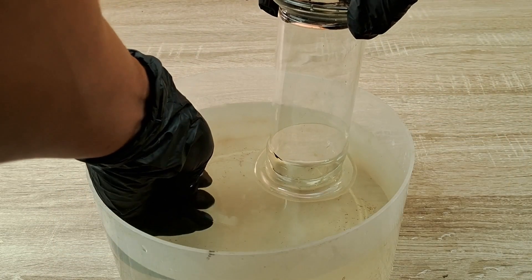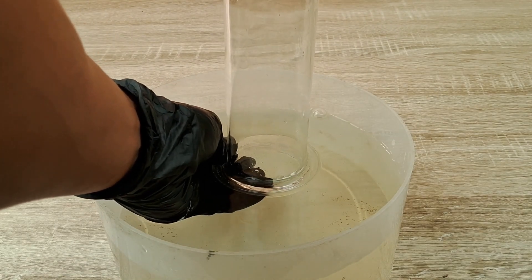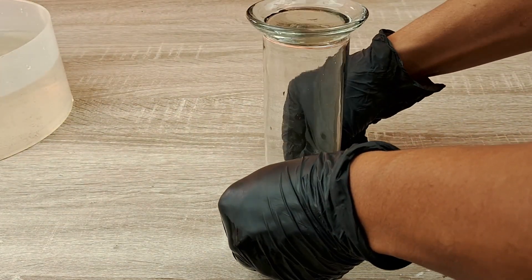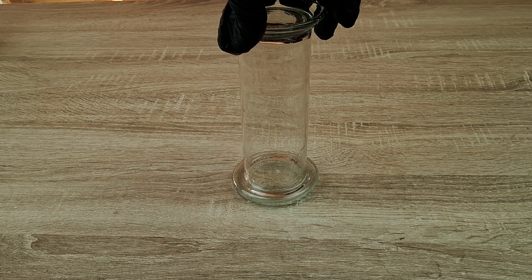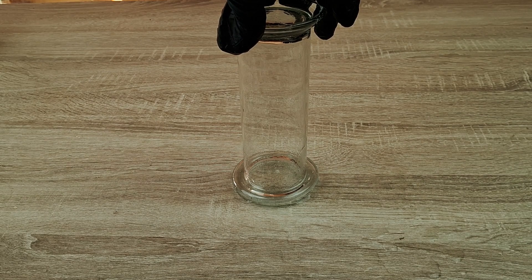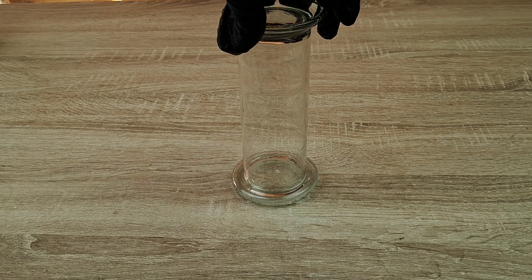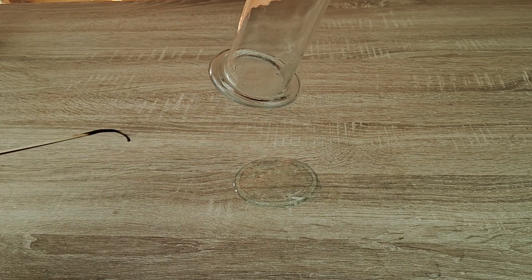Once the jar is completely filled, cover the mouth of the jar with a glass plate or a watch glass and remove the jar from the water. Remove the lid from the jar while still holding the jar upside down, and bring a burning splint, candle, or lighted matchstick close to the mouth of the jar. You will observe that the gas in the jar violently ignites with a characteristic pop sound.